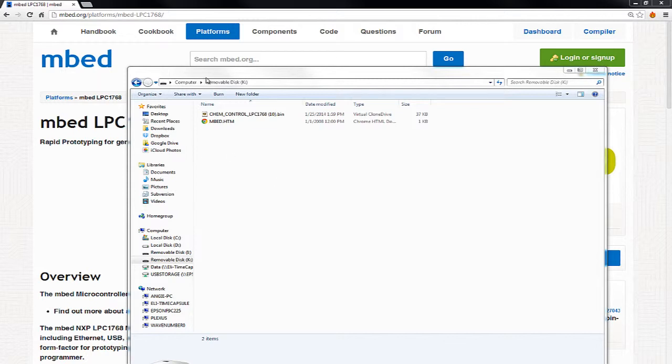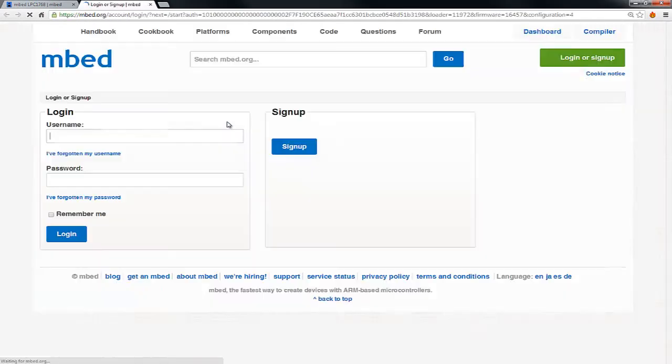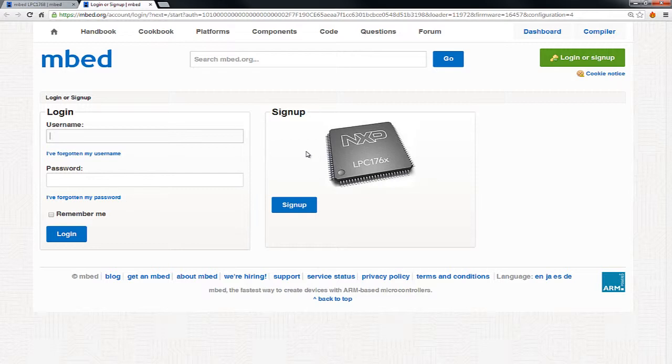For me, it came up as removable disk K, and there were two files on it. One was a file that I was dragging and dropping onto the Chem control while testing the firmware, number 10. The file the compiler generates is just a .bin file. Anytime you plug in a new Mbed, you get this mbed.htm, which takes you to a special sign-up page with a code for the Mbed, where you can sign up to get your own login. I've already done this, and you can go ahead and do it.